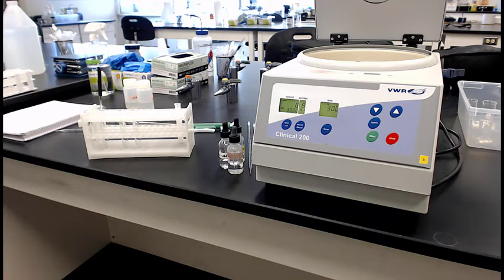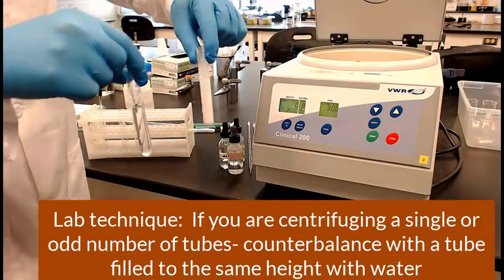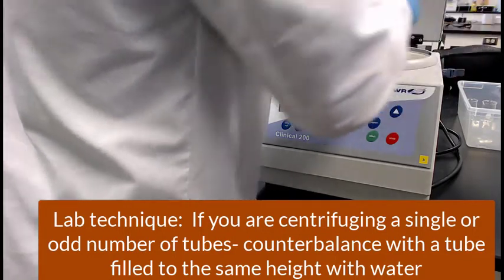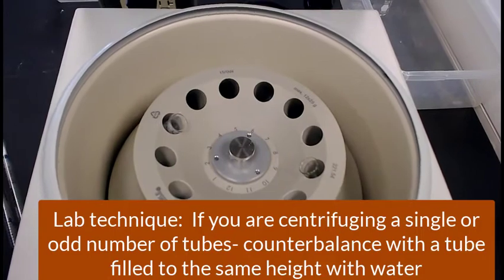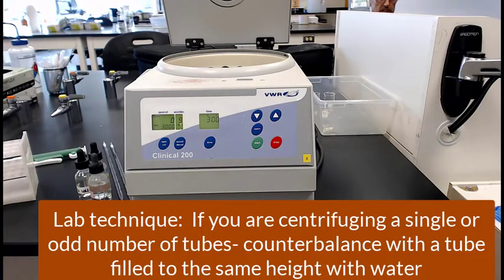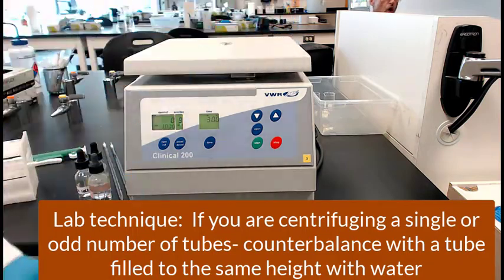So that tube you see right there is just calcium carbonate precipitate with a little bit of the unreacted reactants, right? And now he's trying to get the two tubes to the same height so they can put them in the centrifuge and spin them down. So you put those in there, see if he gives us a view, right? You put them on opposite sides so they'll balance each other. And then the blank tube on the left, which just has water at the same height, will weigh about the same. It's kind of like trying to spin a tire. If it's out of balance, that thing would wobble off the table. So he's got it balanced out, seals off the lid.